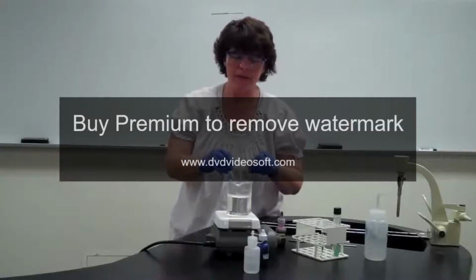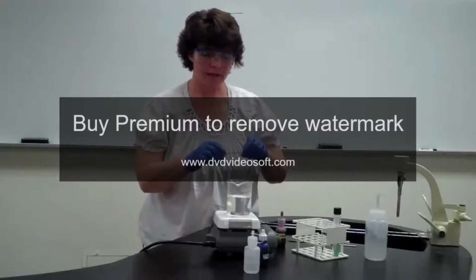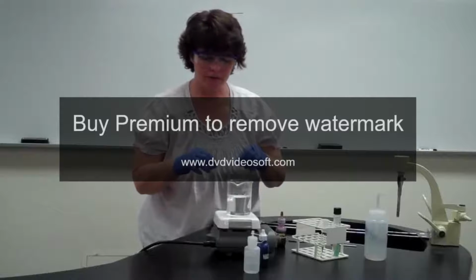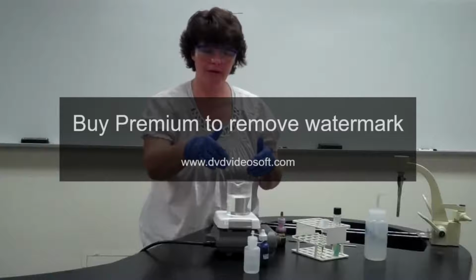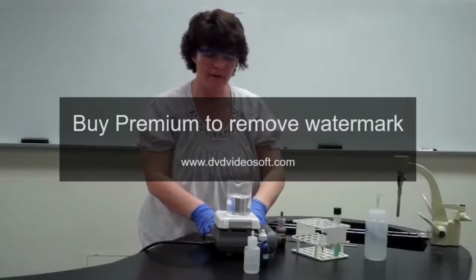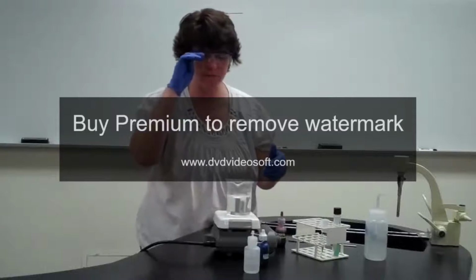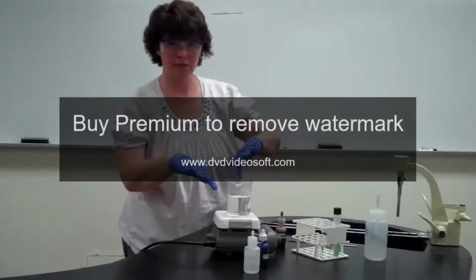So I have my bacteria already prepared, already fixed on the slide. Now when doing this, be careful because it is hot and you don't want to burn yourself. What you're going to do is place the slide on top of the boiling water and have the steam warm the slide. More than one person can do it at a time. The key is to just be very careful and not to burn yourself or knock the slides into the water.